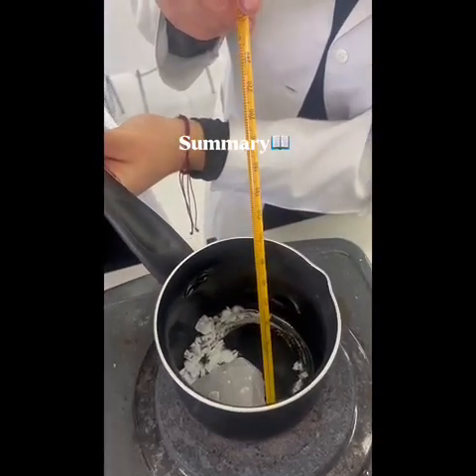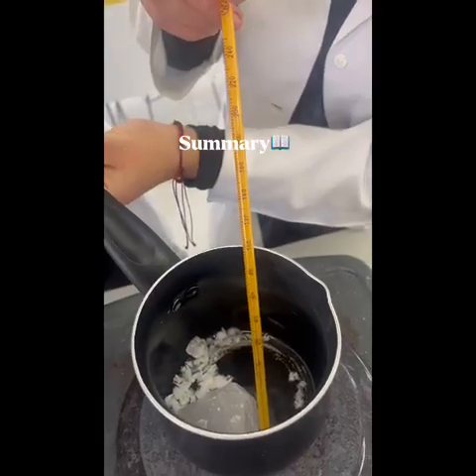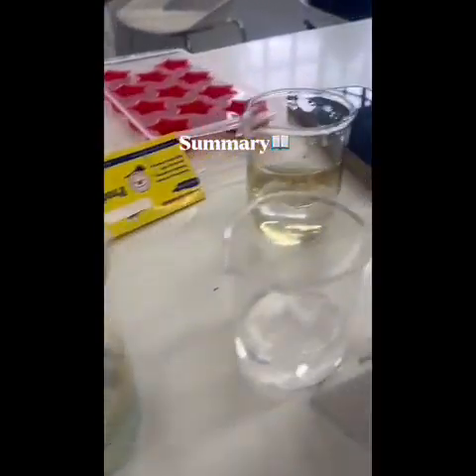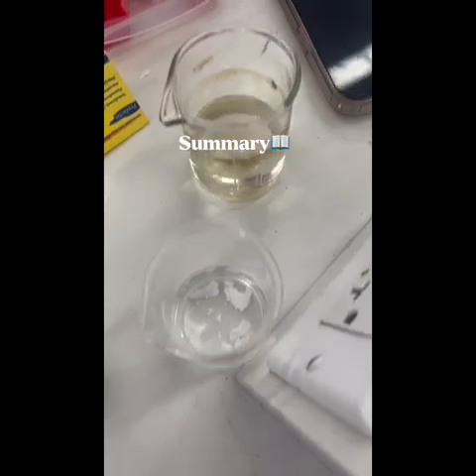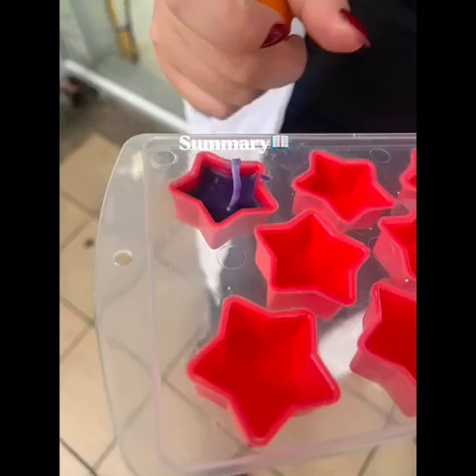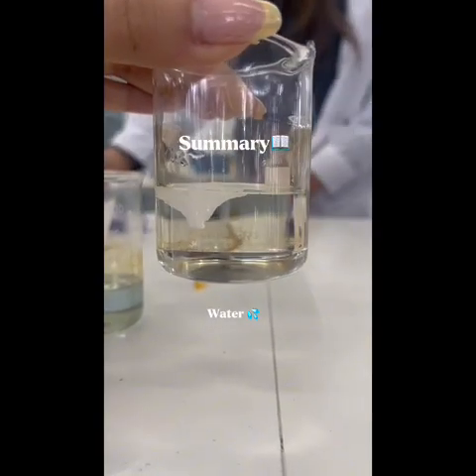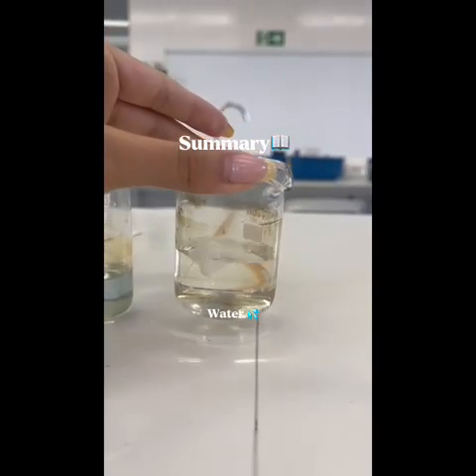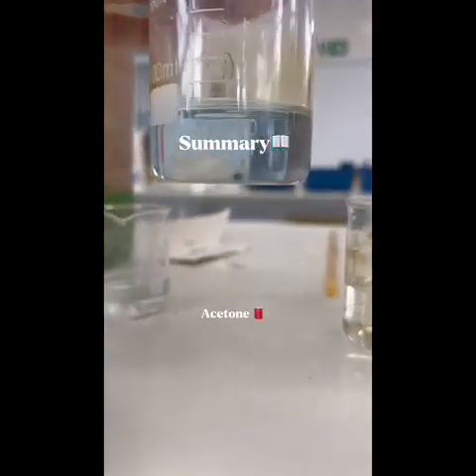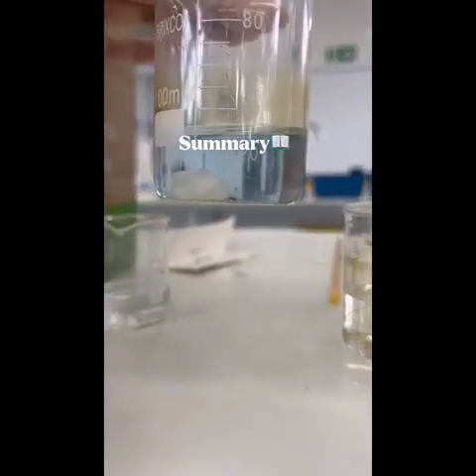In this lab, the main element we worked with was paraffin, which allows us to better understand alkane compounds and how they react to various factors, such as direct heat or substances like ethanol. The learning process was prepared by the creation of a candle, which allows us to better understand a common everyday element. First, the paraffin was observed and analyzed, and then its solubility in water, ethanol, and acetone was tested.